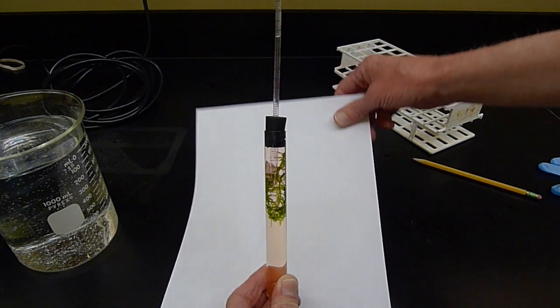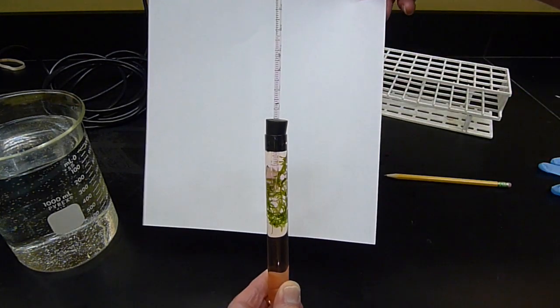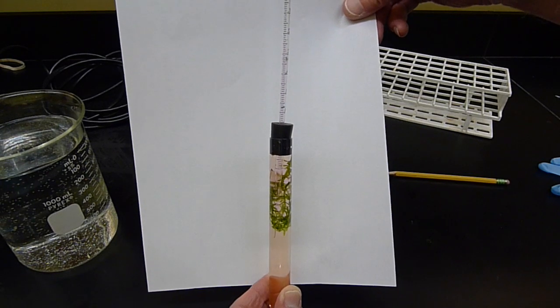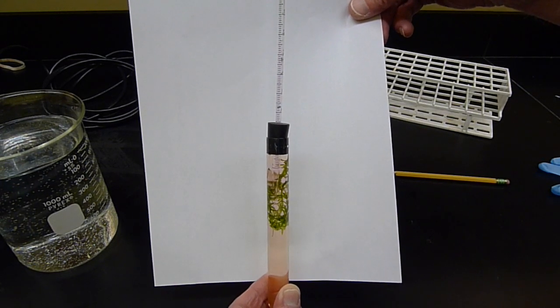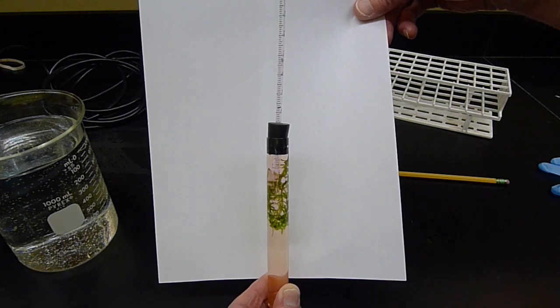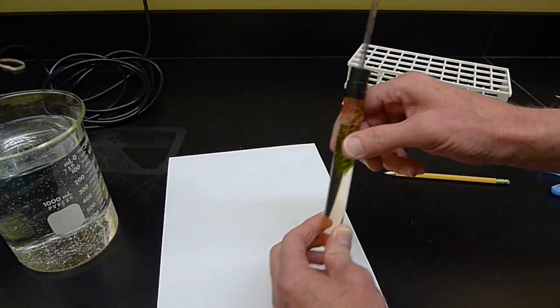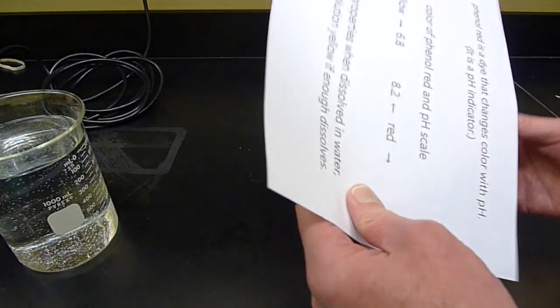And if you notice this, the fluid in the tube here is slightly pink too. I just put a little bit of the dye in there. It could have used more dye, but then dye could be toxic to the Elodea too. In any case, there's a little bit of that pink color. We're going to call it 9 minutes, 45 seconds.